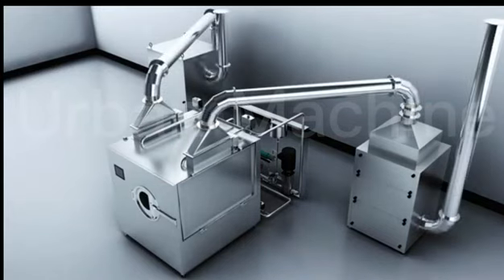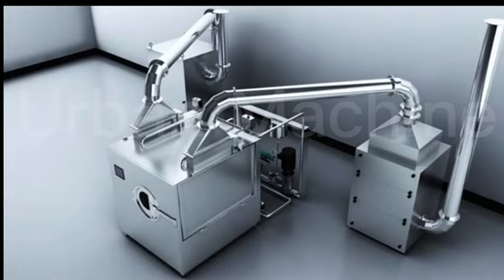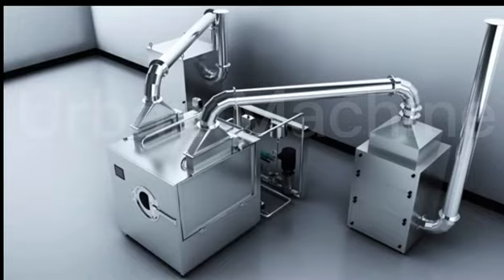During the air exhaust period, it is better to be located away from the main machine room and not in the same room as the main machine.